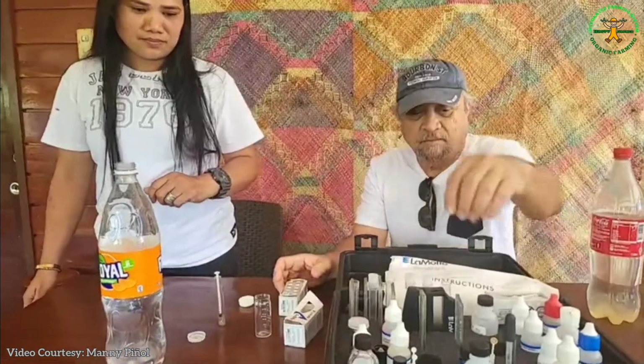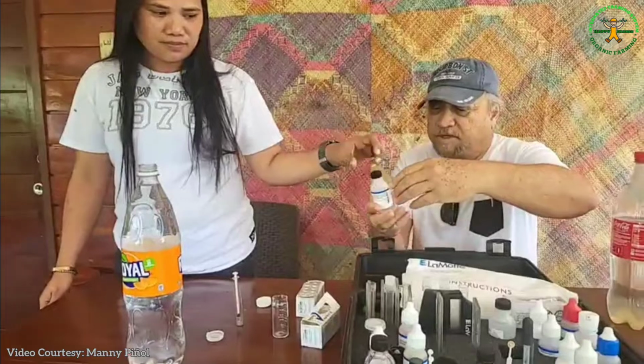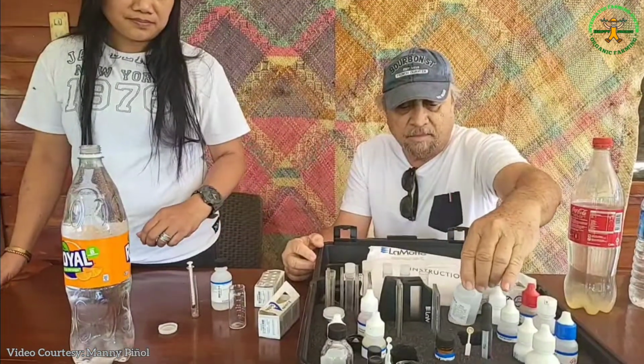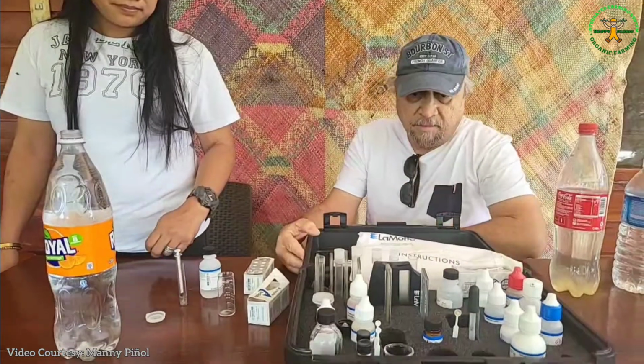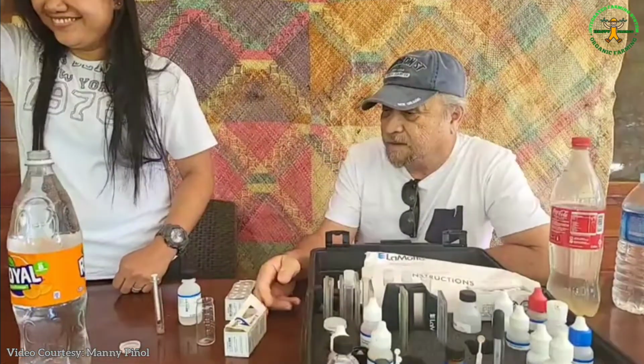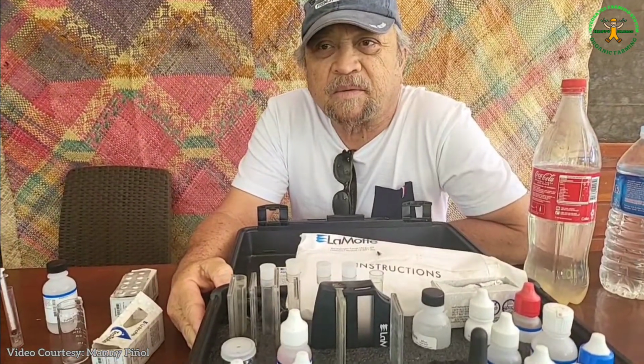Our friend Rocky French, our farmer scientist, will demonstrate how to test freshwater for alkalinity. First, may I ask Rocky, why do you have to test the freshwater for alkalinity?